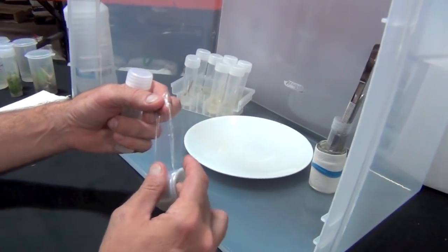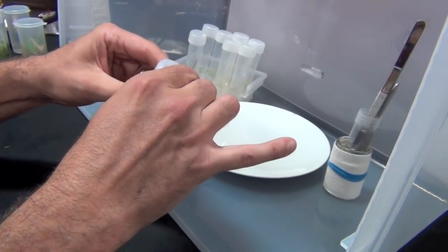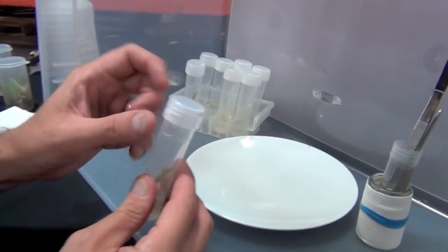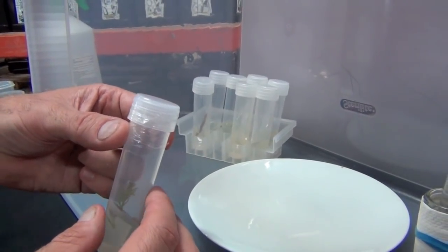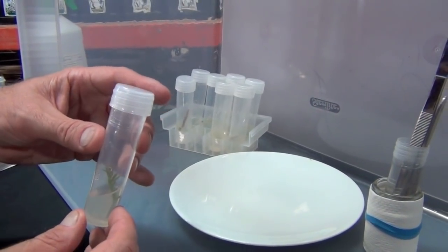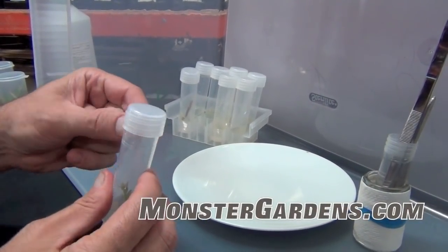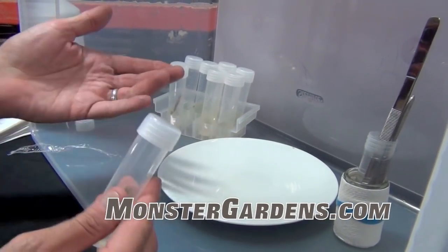It's going to have a little tiny hole so air will get through it, because these are never completely sealed — but small enough that it'll prevent bugs and particles from getting into the tubes. So the tape is just for taping the gap. And when you take the tape off, the gap is still clean of dust, just like we sprayed it before.